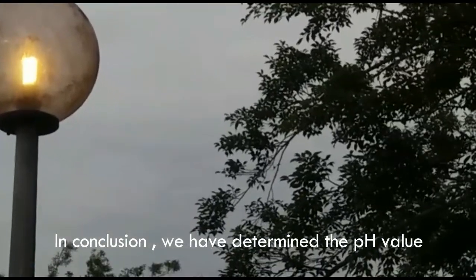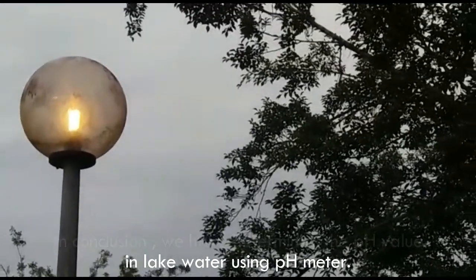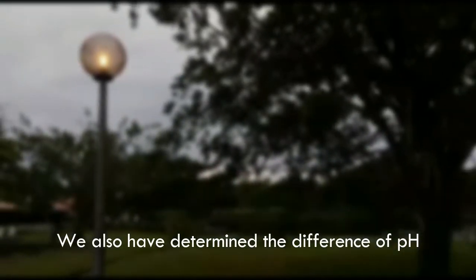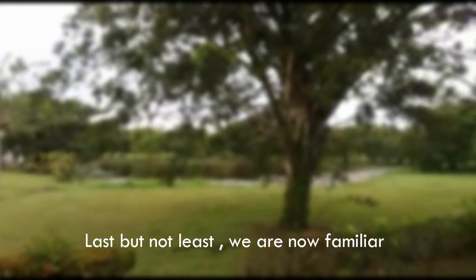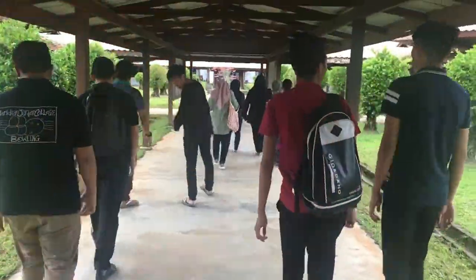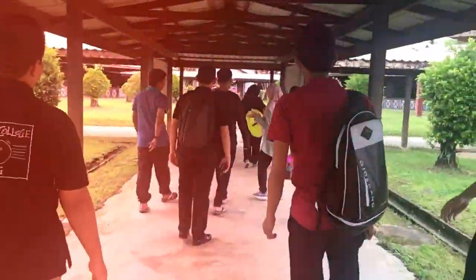In conclusion, we have determined the pH value in lake water using a pH meter. We have also determined the difference of pH in the three lakes in Unimas East Campus. Last but not least, we are now familiar with the concept of alkalinity and pH in water. I hope that we as students can maintain a good ecosystem around the lake and avoid polluting the lake.